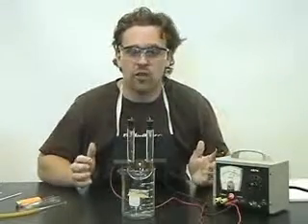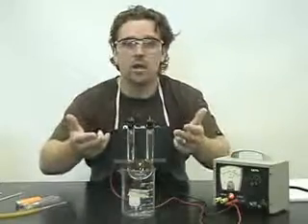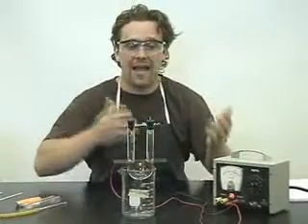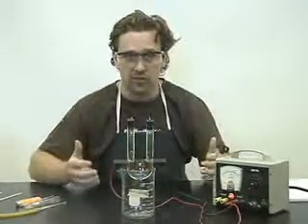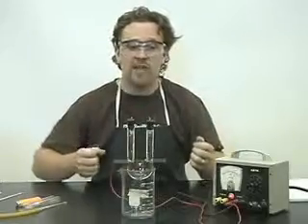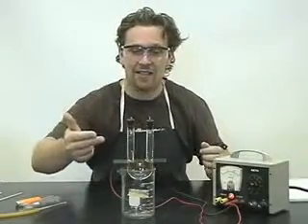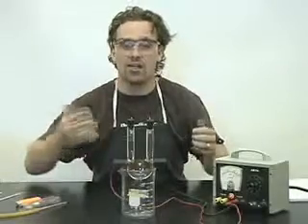So remember the two water equations. In the solution we have water — H₂O, water only. We're having the reduction of water and the oxidation of water. The reduction of water produces hydrogen gas. Hydrogen gas is produced at the cathode where reduction occurs. Oxygen gas is produced at the anode where oxidation takes place.